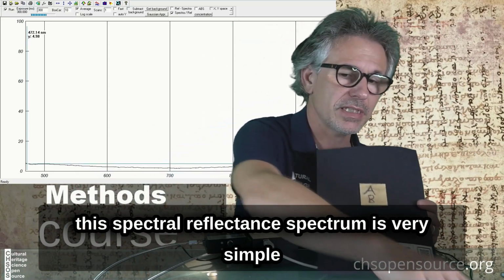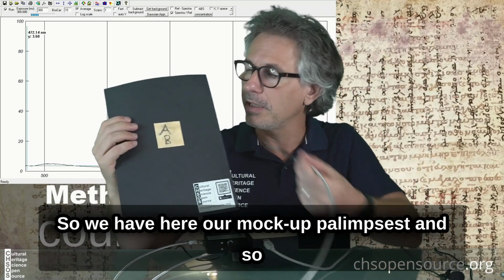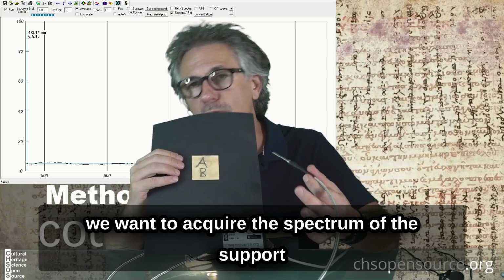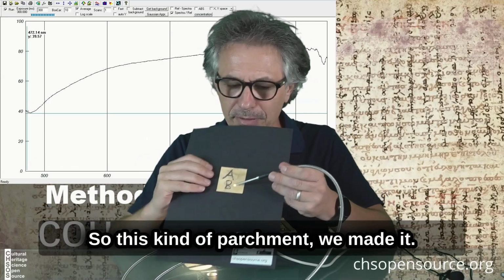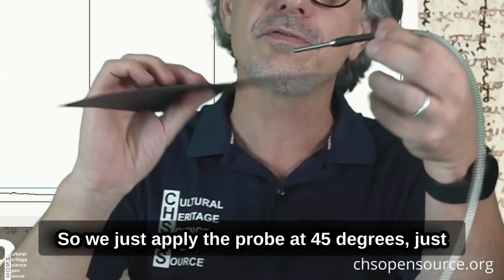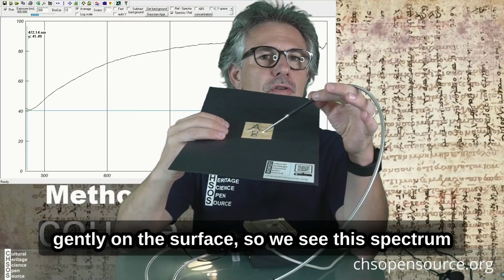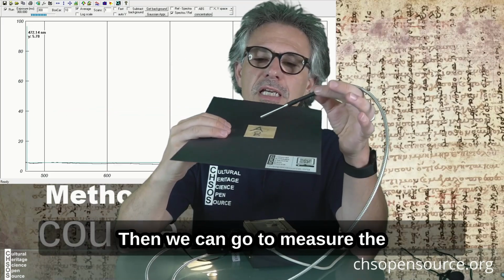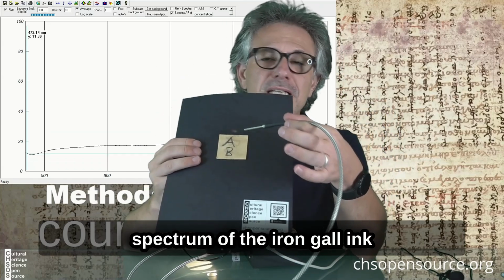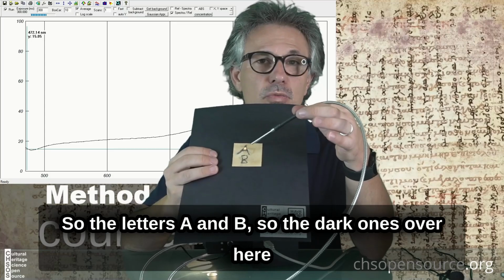The reflectance spectra is very simple. So we have here our mock-up palimpsest, and we want to acquire the spectrum of the support. This kind of parchment, we made it. We just apply the probe at 45 degrees, just gently on the surface, so we see this spectrum. Then we can go to measure the spectrum of the iron gall ink, so the letters A and B, the dark ones over here.